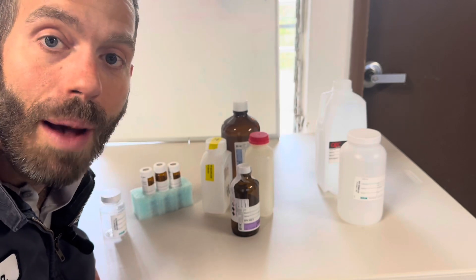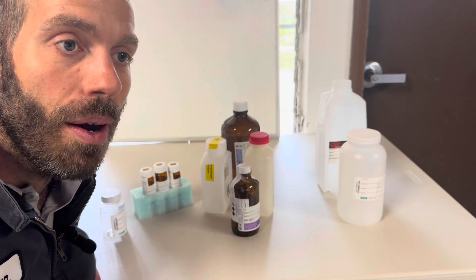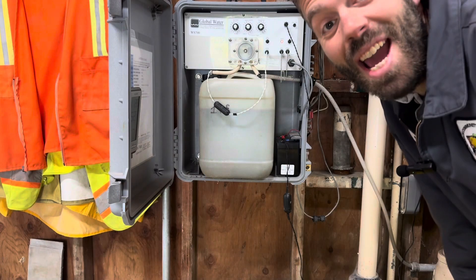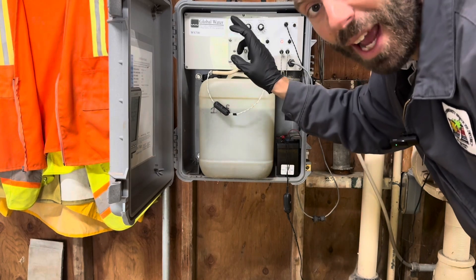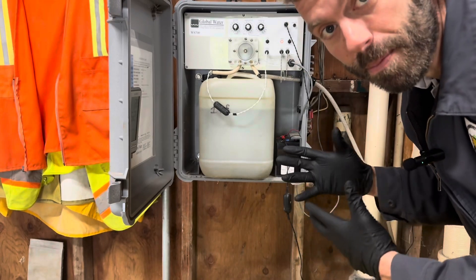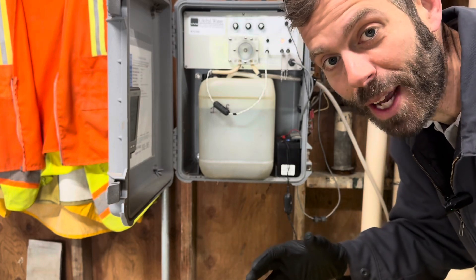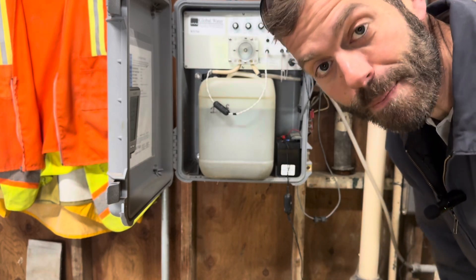We're going to stop here for today, and tomorrow we'll pick up with our 24-hour composite samples being full — we'll mix them up, pour them off, fill out our paperwork, and talk about chains of custody and labeling our bottles. [Next day] We're back — the sample container is full. The little red light tells me the bottle switch has been activated so it doesn't overflow. I've already got my bottles labeled — let's pull the composite sampler and fill some bottles.